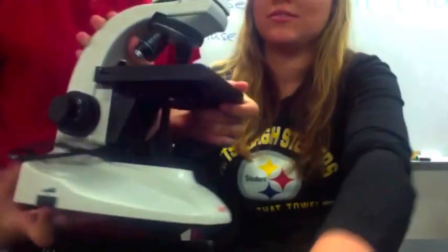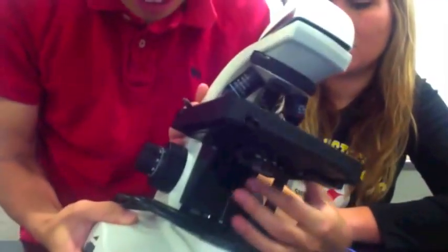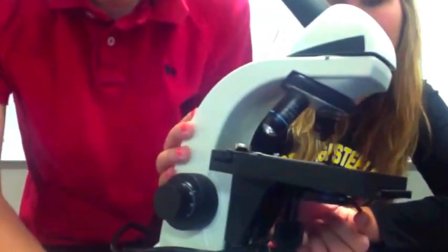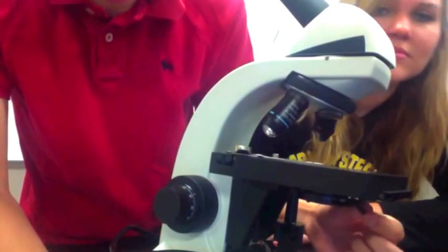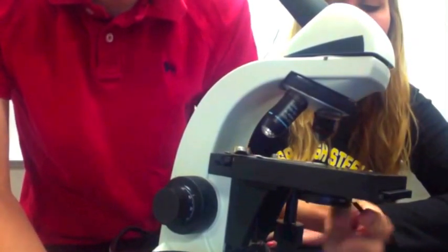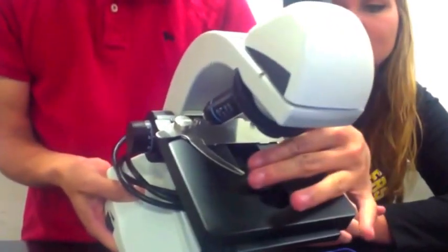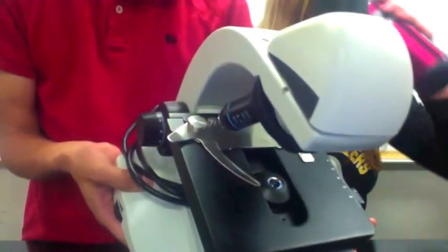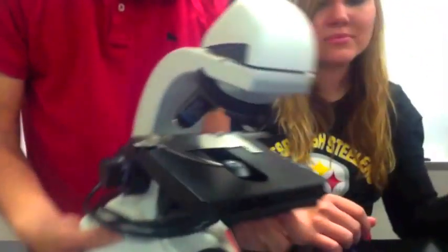There are two more parts. This little lever right here that moves is called the iris diaphragm lever. What it does is open or close the area that light passes through, so you can control how much light comes through — open or close.